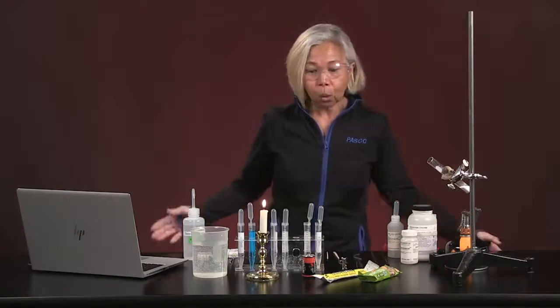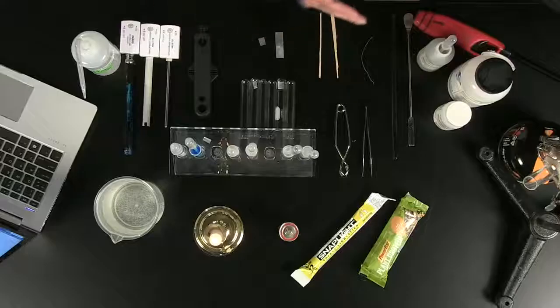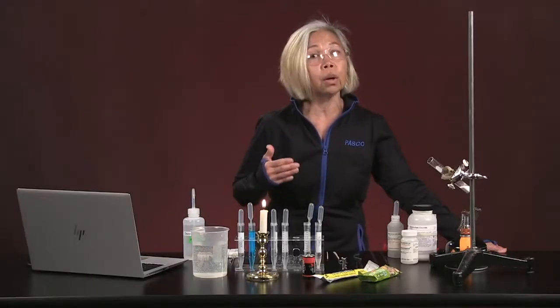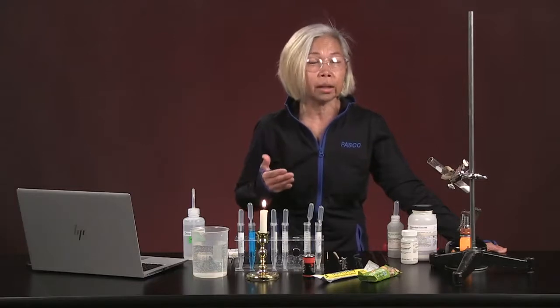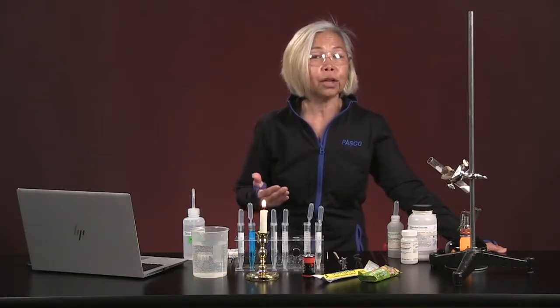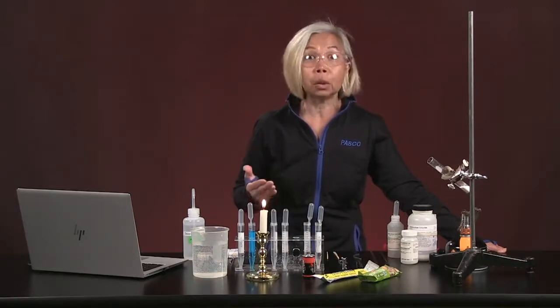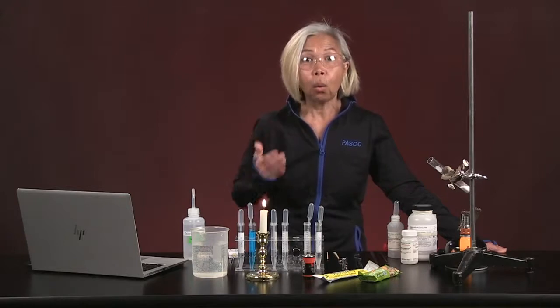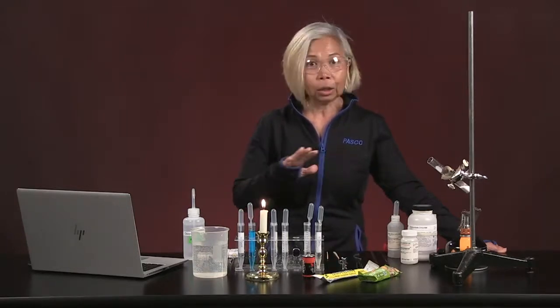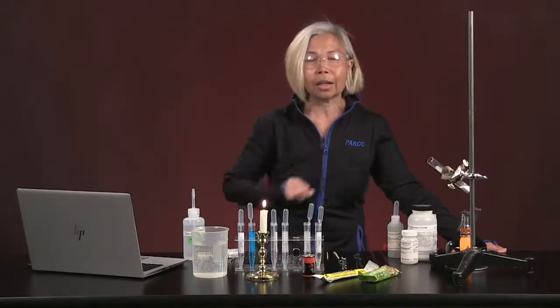In today's lab, we are going to be examining exactly that. We're going to be going through a large series of chemical reactions. You are going to be recording the qualitative data from each of these reactions. And then we're going to move into a second part in which we will actually collect some quantitative data of a chemical reaction. It's a lot to handle, but it's going to be a lot of fun. Are you ready? Let's get started.